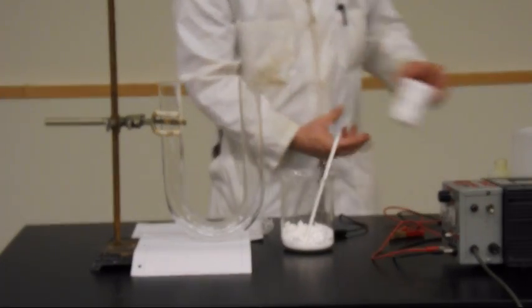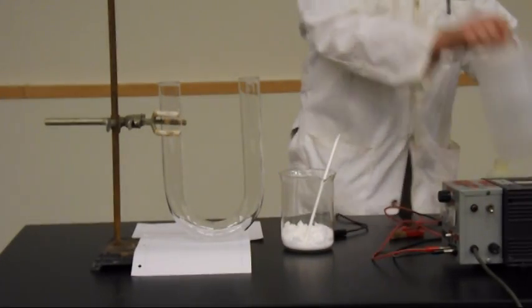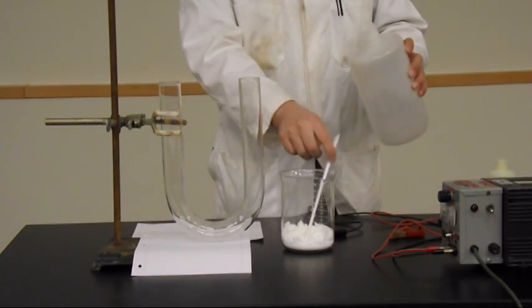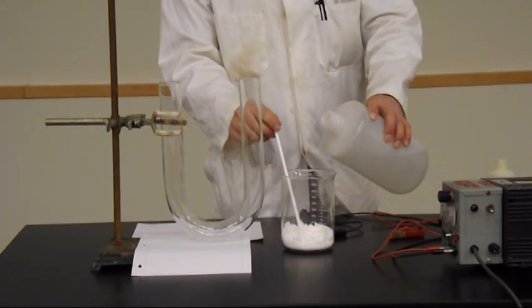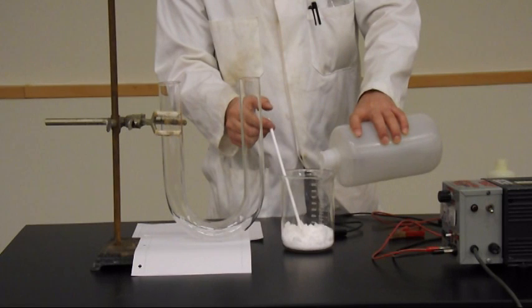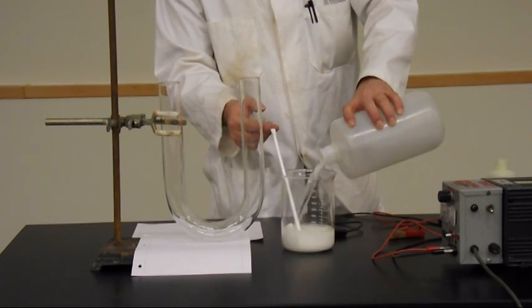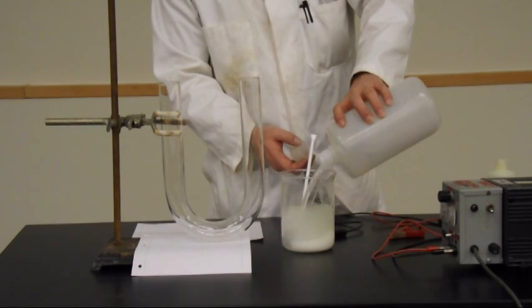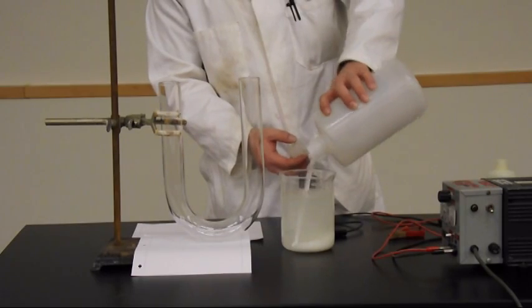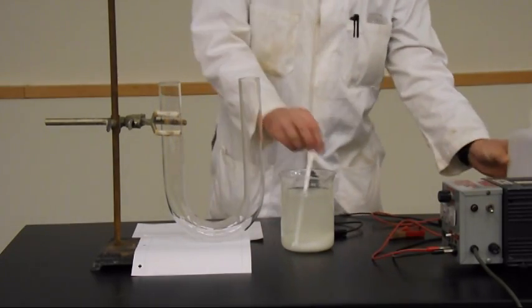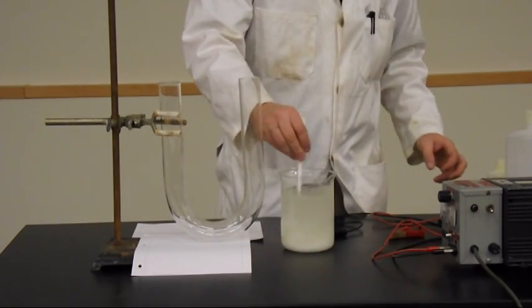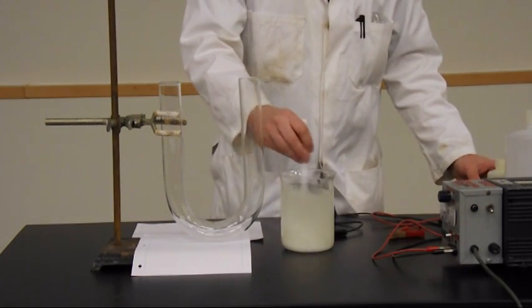Not a chemical that is too much of a concern from a safety perspective. Actually you can buy it in pill form and it was sold quite prolifically at the end of the Fukushima disaster a few years ago. So I'm just making up effectively a 2 mol per liter potassium iodide solution.